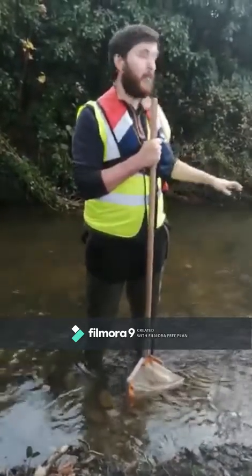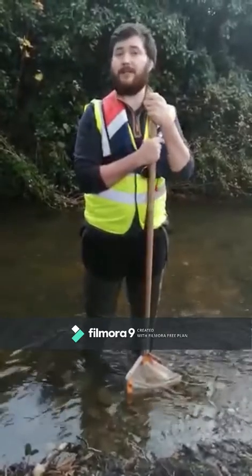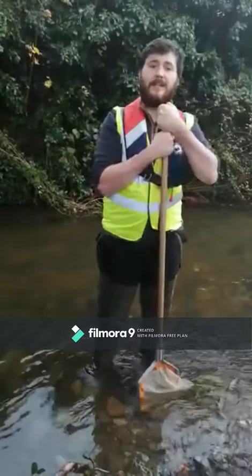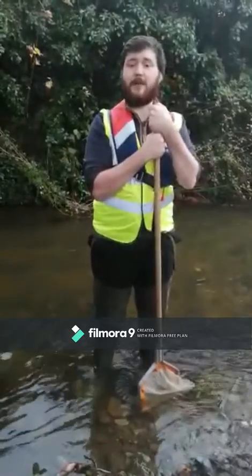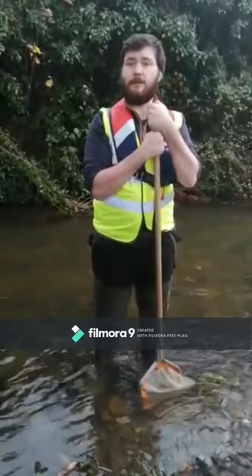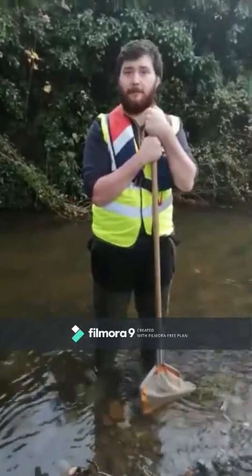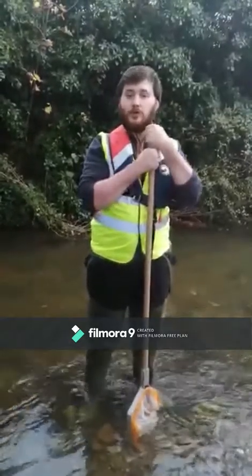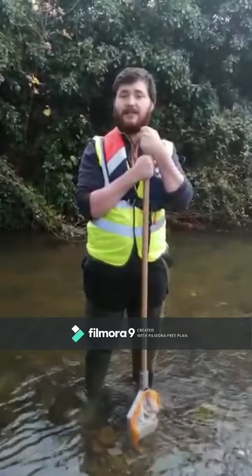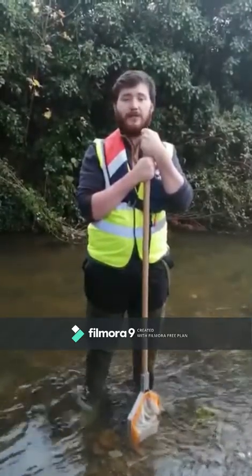To assess the water quality of the Big River, I'm going to be using aquatic macroinvertebrates as bioindicators, along with other variables. These variables include the depth and width of the river, pH, conductivity, parts per million, temperature, along with the substrate type and flow type. To collect the aquatic macroinvertebrate samples, I'm going to be using the standardized EPA methods of kick sampling followed by hand searching for a duration of 3 minutes.